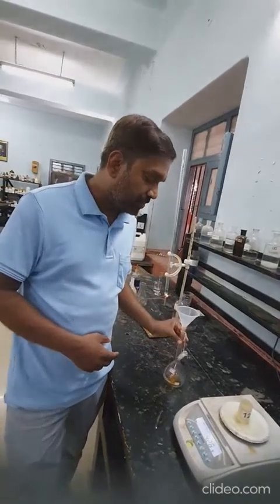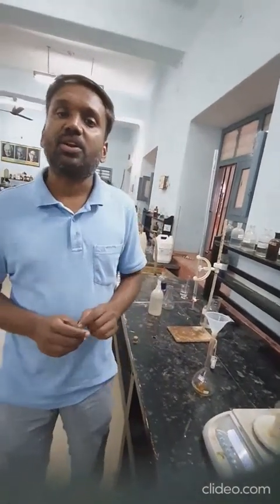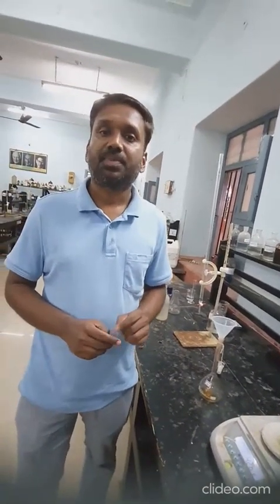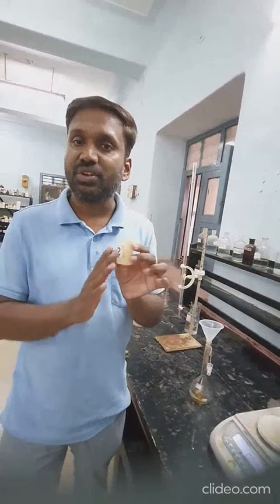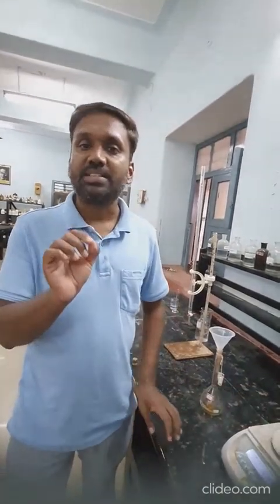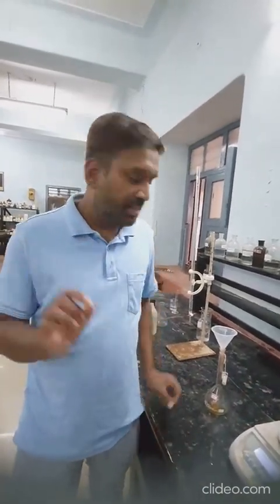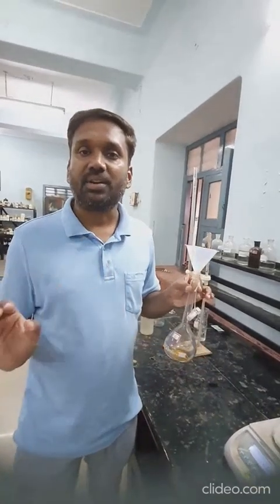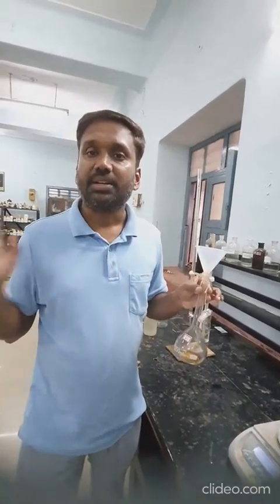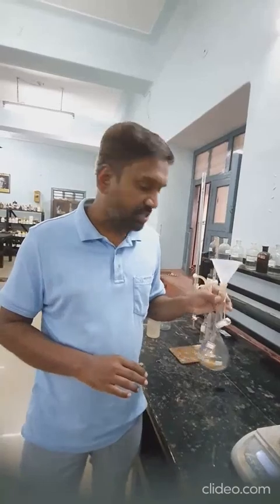Now you have to calculate the normality of the solution for the weight of the crystal you have taken - not for the weight that was given inside, which you will never come to know. Instead, it is always the W1 minus W2 weight which you have taken that should be used for the calculation in your experiment.